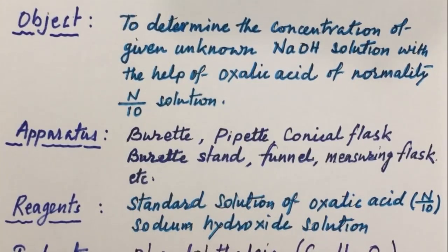For this titration we also require some reagents. These reagents are standard solution of oxalic acid having N by 10 normality and sodium hydroxide solution.